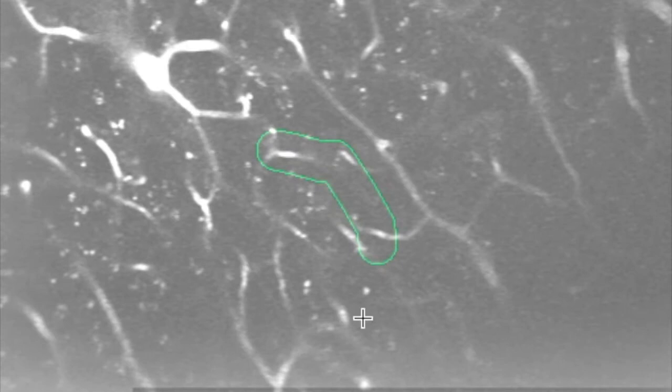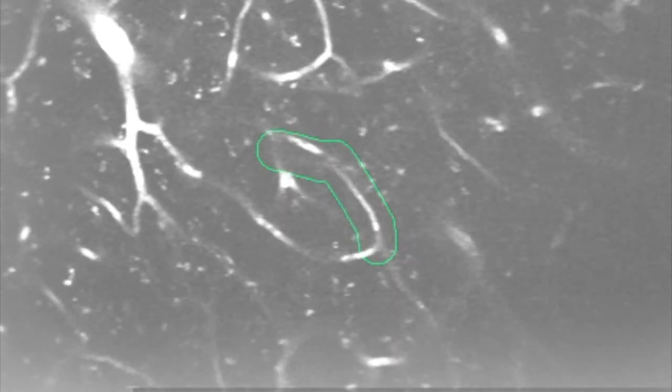So instead, as you look at this image here, the piece of vessel we want you to see, you see the branching point here into two different directions. And again at the bottom, you see it branch in two different directions.